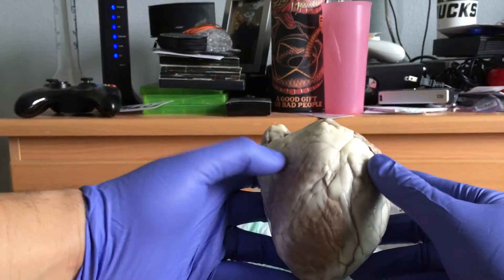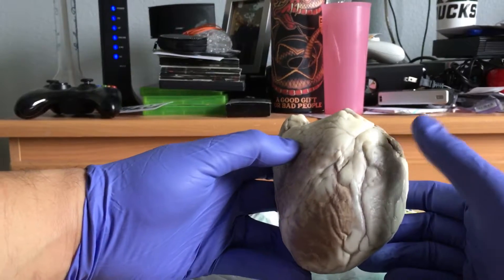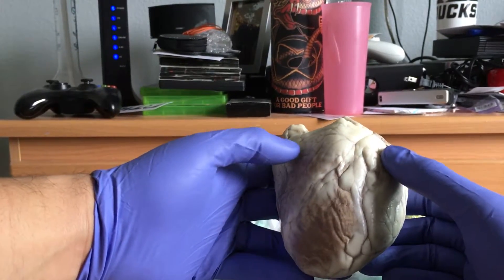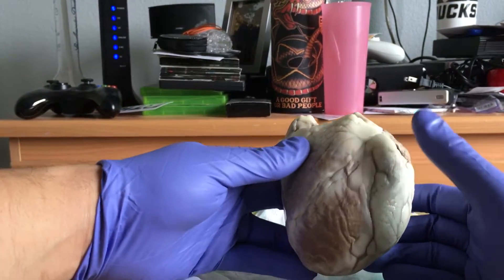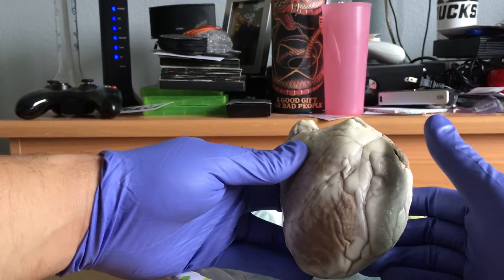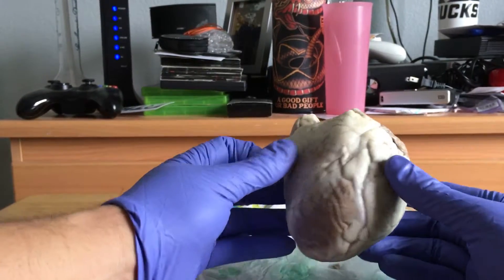The right atria would be over here, and the left atria would be over here. The right atria has deoxygenated blood, where the left atria has oxygenated blood.